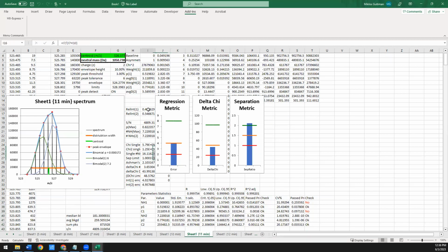So in this case, if we're looking at, say, the relative intensity of the green population, that would actually correspond to this C1. This was the value in total intensity that it was found to get the best fit. This is the standard error associated with it. And if you look at this CV percent, that's actually the percent error associated with it. And that's actually not that low, meaning that in this case, you could say, yes, the green population is about 45% of the total population, but with an error of 24%. And the same goes for the blue. The blue population is 54.6% of the total intensity, but with an error of about 20%, which is kind of high.